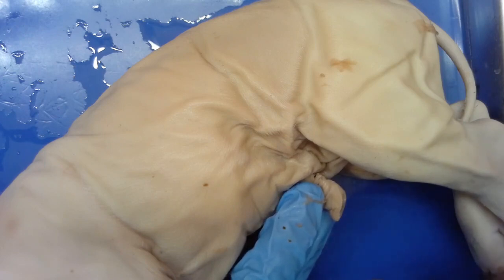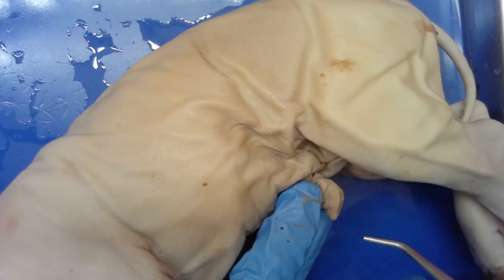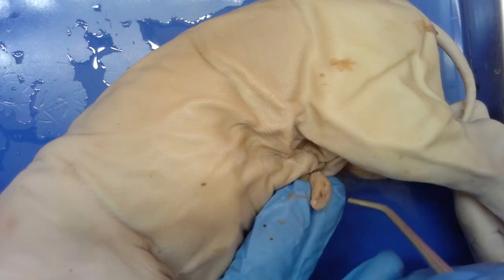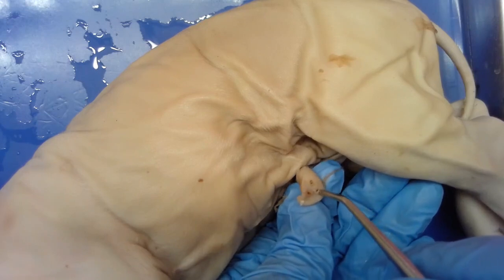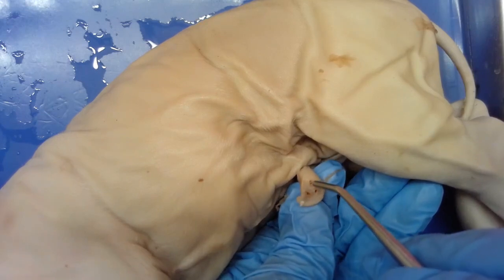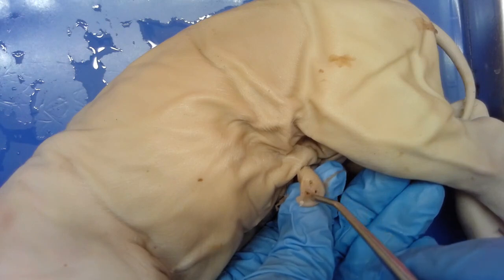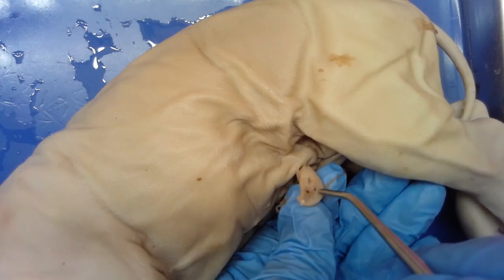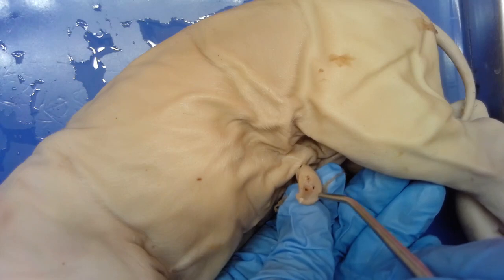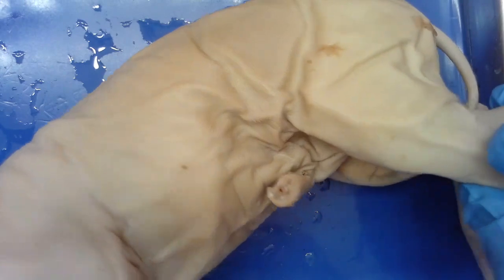There is an umbilical vein in there — you can see the umbilical vein — and then there are two smaller umbilical arteries with a thicker wall. You can also see an umbilical vein that has a larger lumen. So that's what's in the umbilical cord.